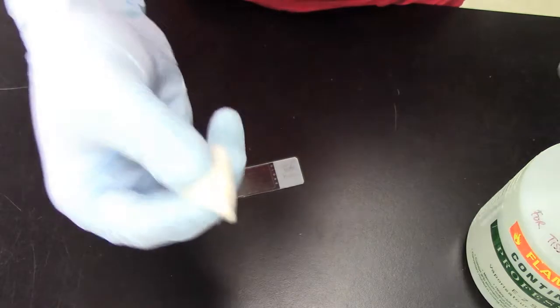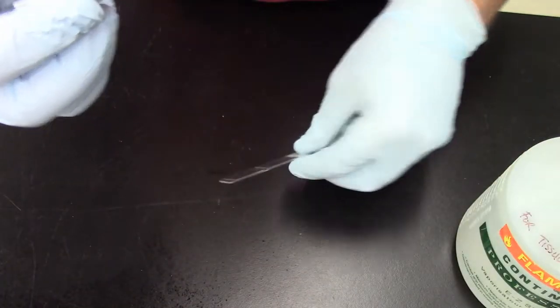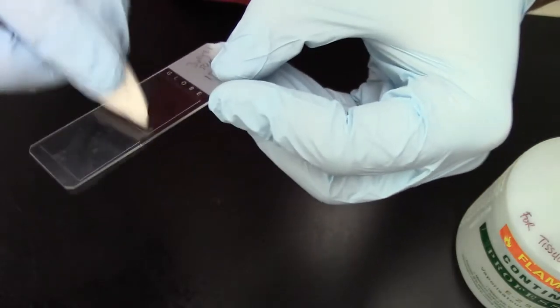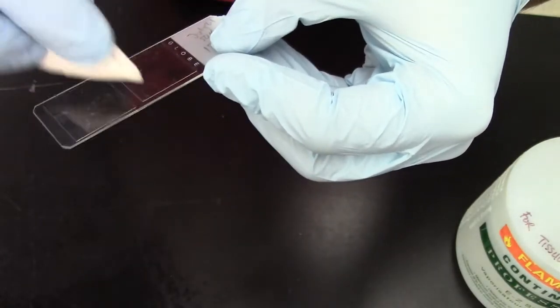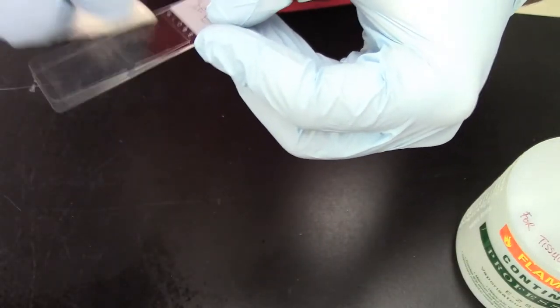And this is really not rocket science. You just kind of make a wedge out of it. You spray it with some more alcohol and you repeat this exercise once again. Okay. Very carefully. Make sure it is nice and clean.